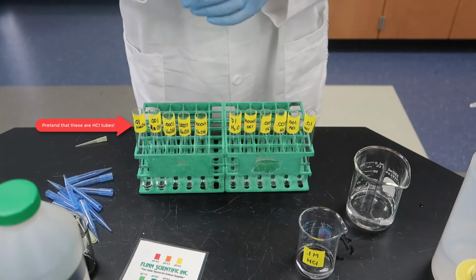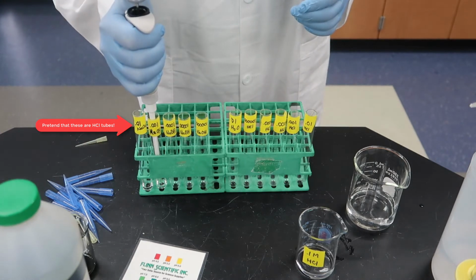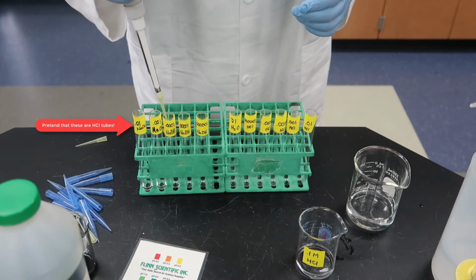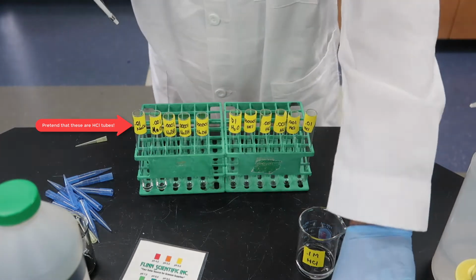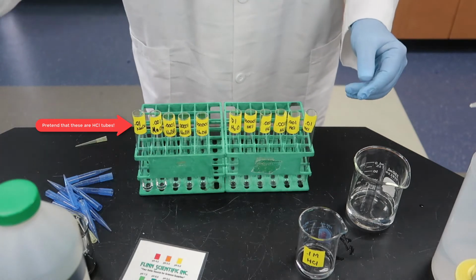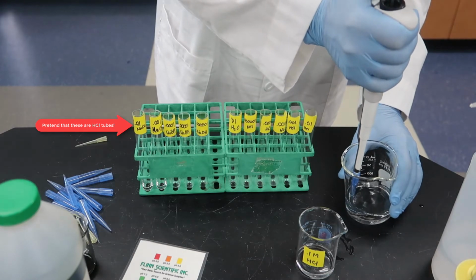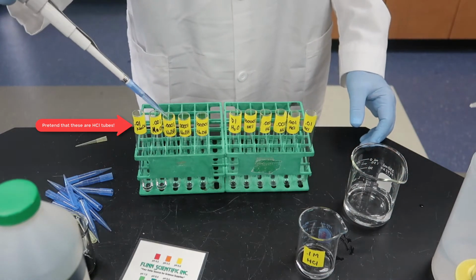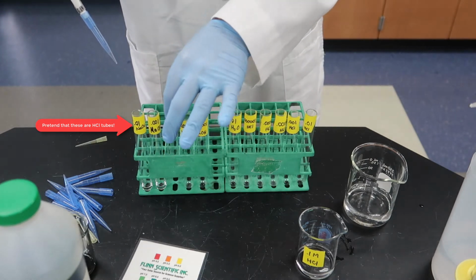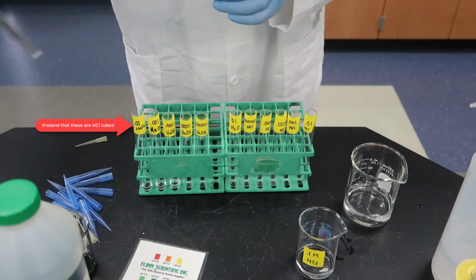So there's our 100 microliter micropipette. And we're going to take some of that solution, put it in the next one. And notice that we're using a new pipette tip each time. Pipette tips can cause cross-contamination if you don't. And again, we're adding our 900 microliters of water. And mix it up a little bit. Two more to go.